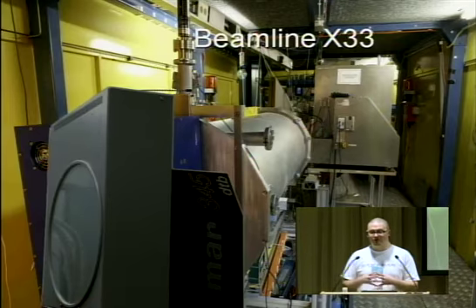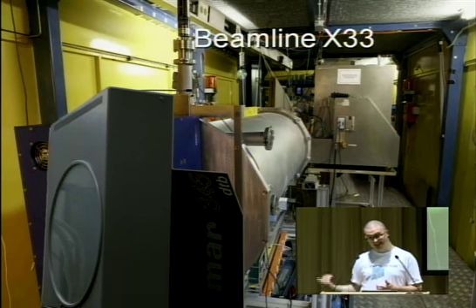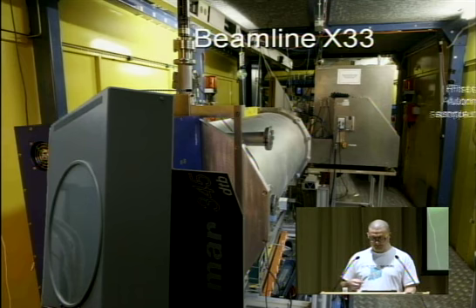This is our old beamline X33 at the old synchrotron that is now shut down. Back then we had the MAR image plate detector, where you needed 2 minutes to get the data out of the detector. Actually 1 minute to get the data out and 1 minute to erase the detector to make it ready for the next exposure. The exposure time was also 2 minutes, so it was not such a big problem.